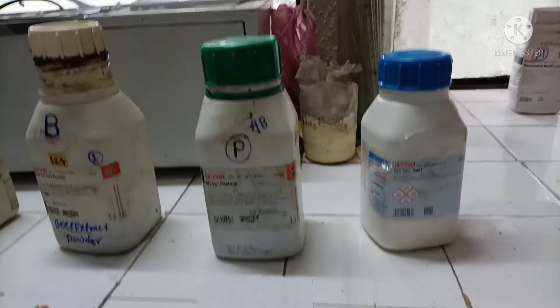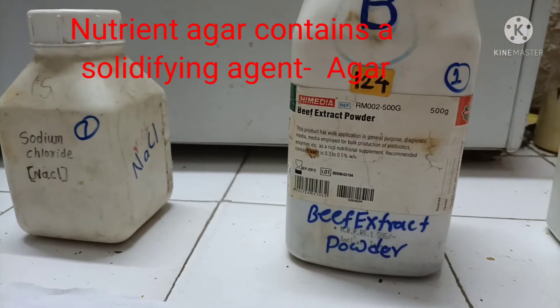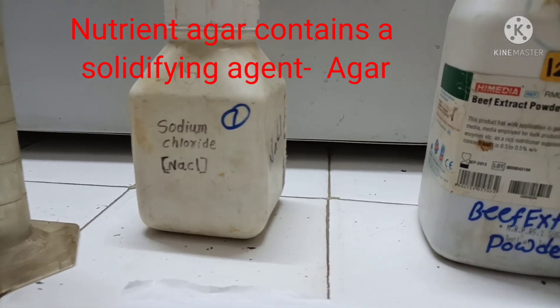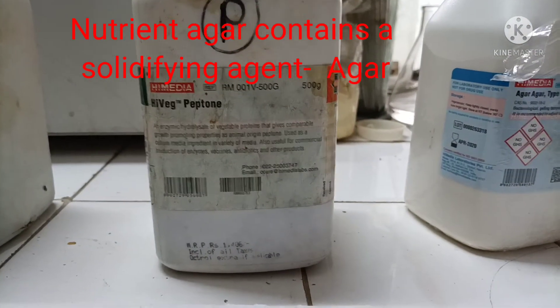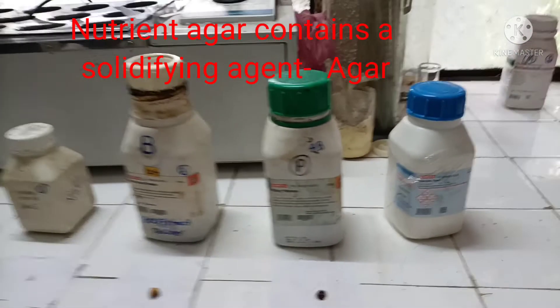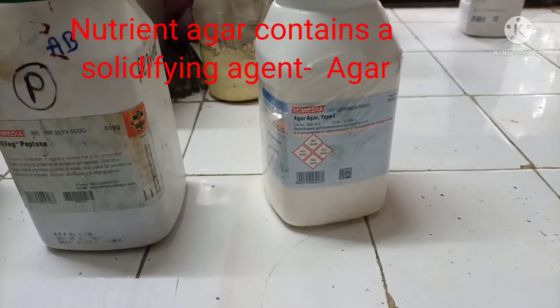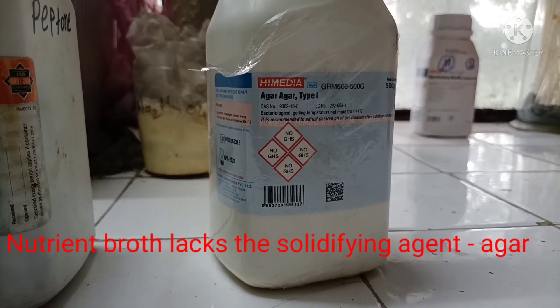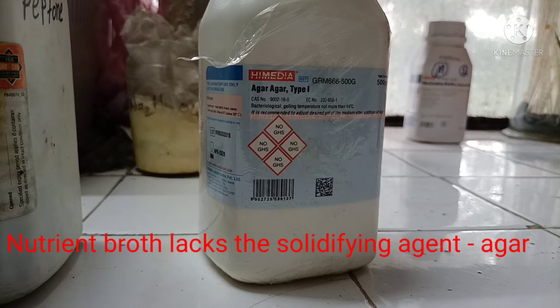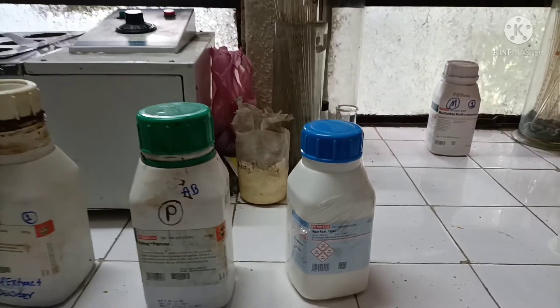We have seen the preparation of nutrient broth and nutrient agar. They share almost the same composition. The main difference is that nutrient agar contains a solidifying agent — agar powder — which is added into the nutrient broth to make the medium solid. Nutrient broth lacks this solidifying agent, so it is a liquid medium.